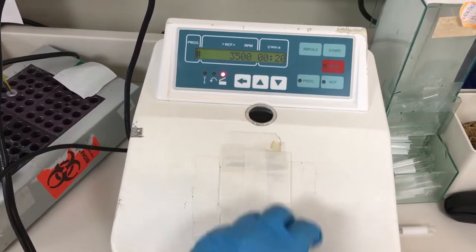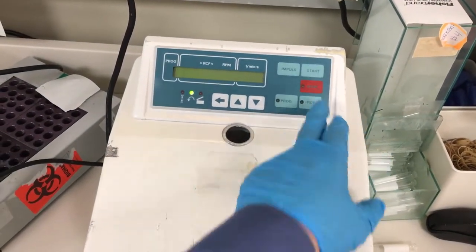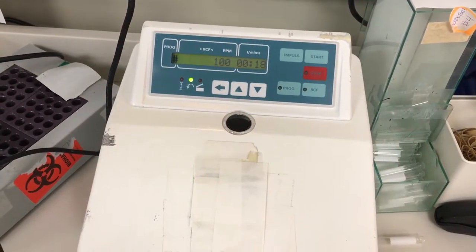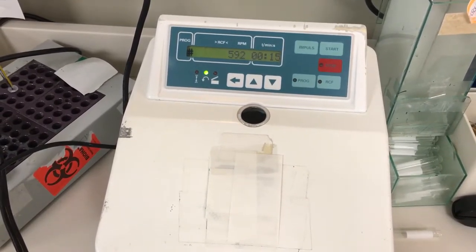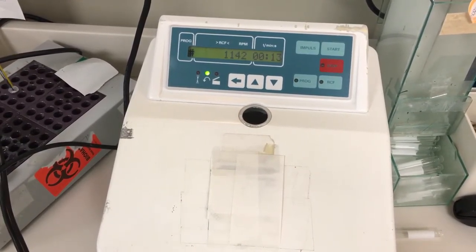Let's do this. Let's try to start. Okay, the speed must be 3500. Zero-zero, three-five-zero-zero.